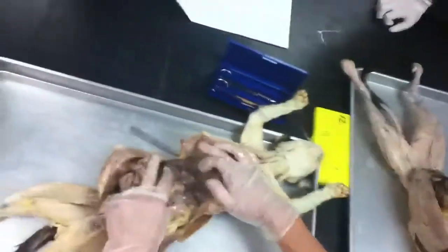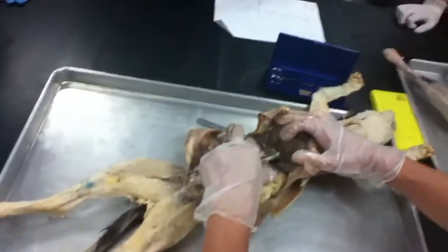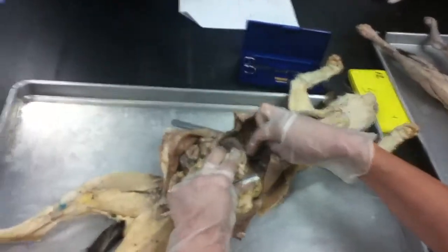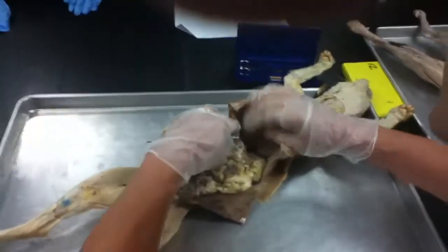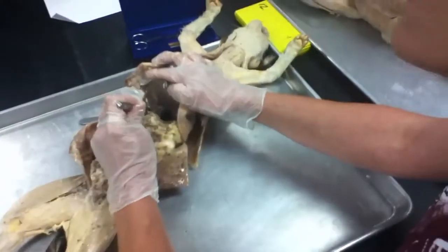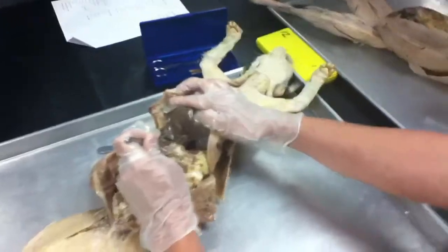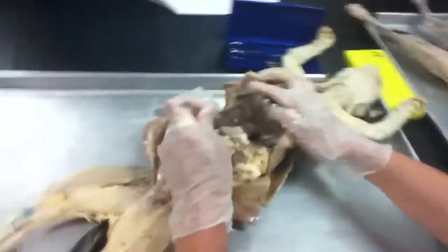Coming out of the liver and gallbladder, what was the important chemical that comes out of liver and gallbladder? Bile. Bile, for breaking down fats. Good. And so it dumps into the duodenum, which remember is the first turn of the small intestine. If you look, you can see in some of them, and you might need to clean up some more of this connective tissue to see it really well, but this one you can see it very easily. Do you see that kind of green tube that's going down into the duodenum? Okay? It's the common bile duct, okay?